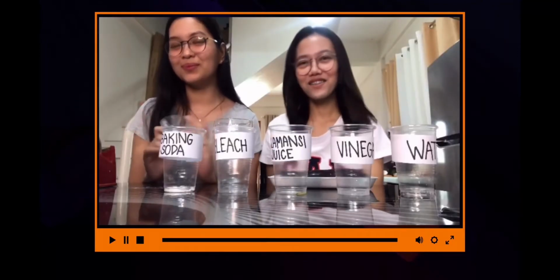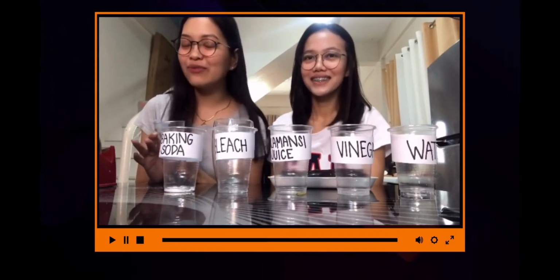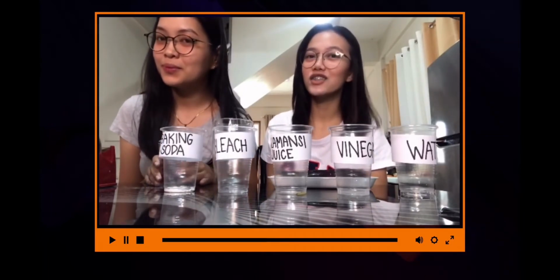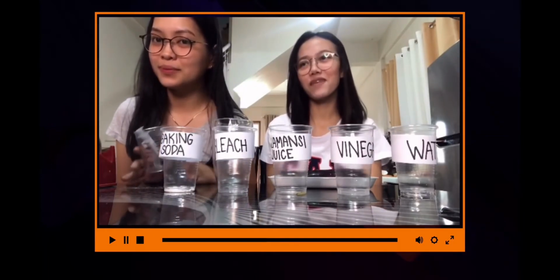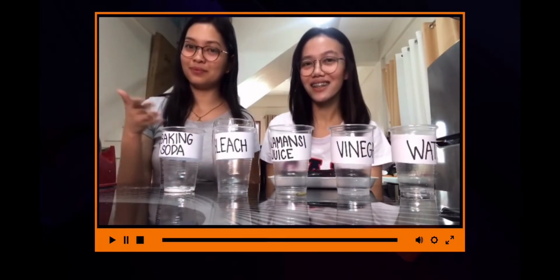Hi guys, I am Angelica Gunyo. I'm Joyce Bacalo. We're from BSMT 151 Section 26. And for today's video, we are going to try dried eggplant peels as our natural pH indicator. But first, let us discuss what are the materials needed in this experiment.